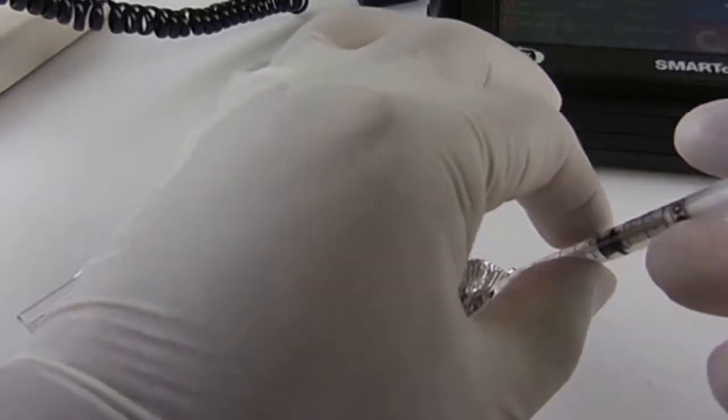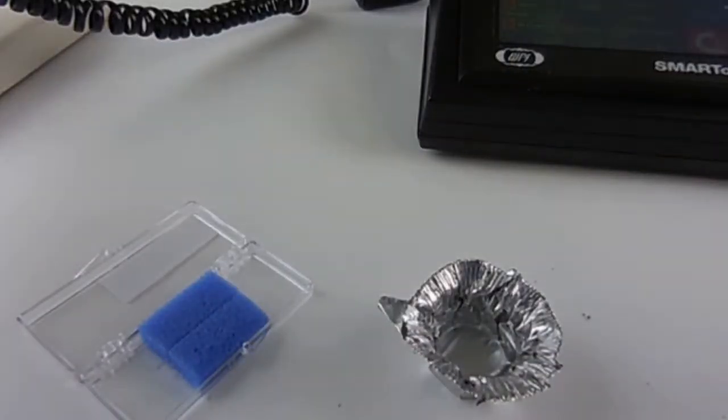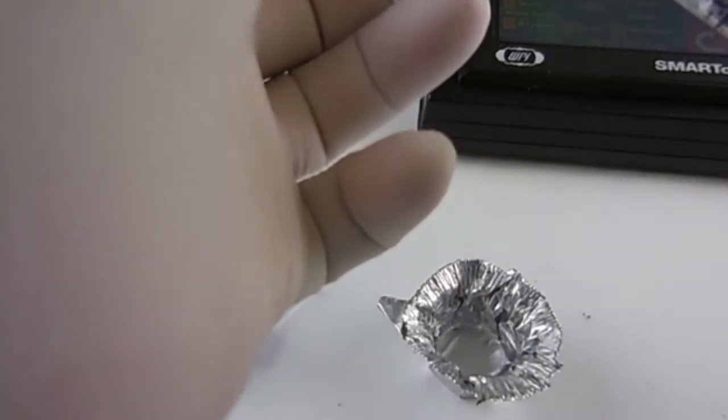While handling glass, you should always use gloves to avoid any natural oils from your fingers transmitting to the glass.